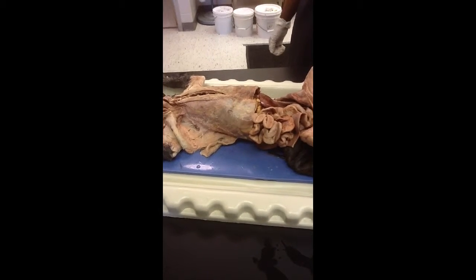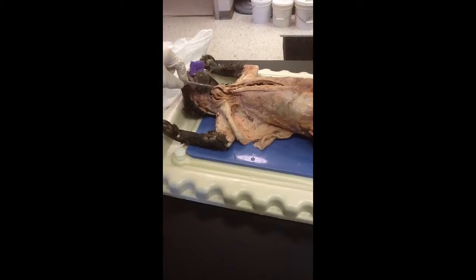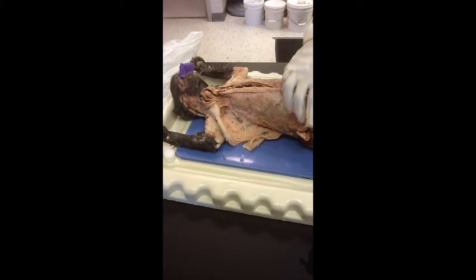Where were the lymph nodes again, Spencer? Yeah. And that would be your lymphatic system.